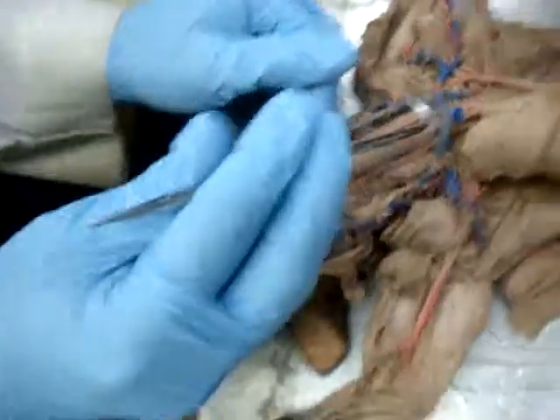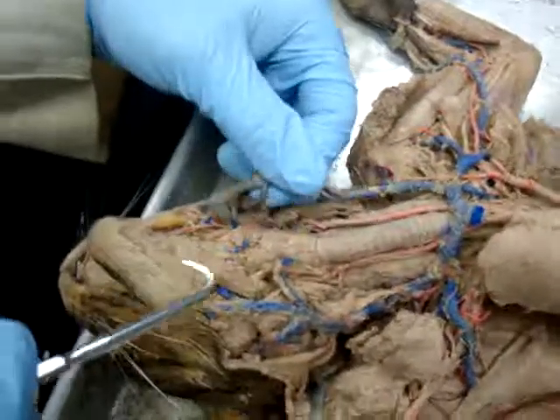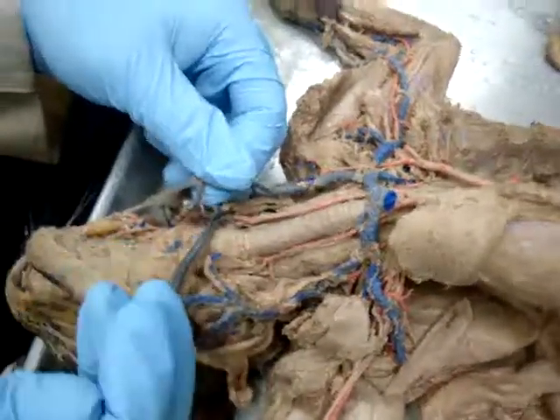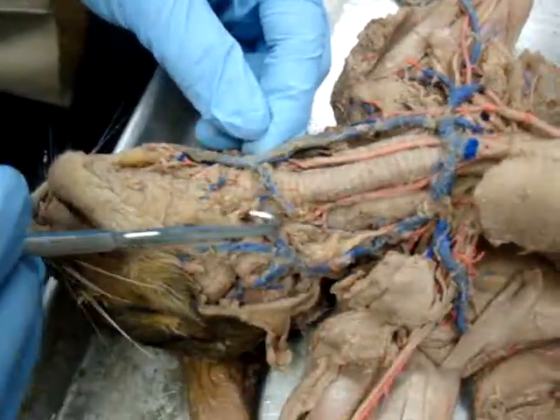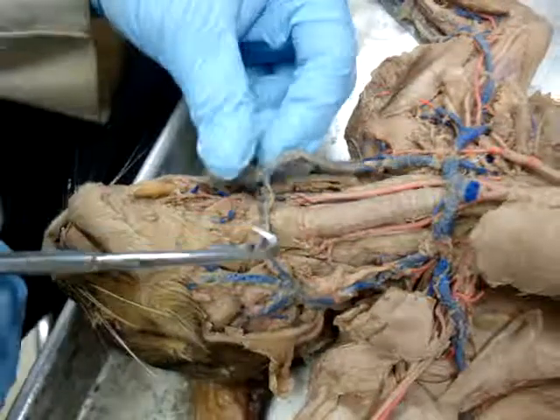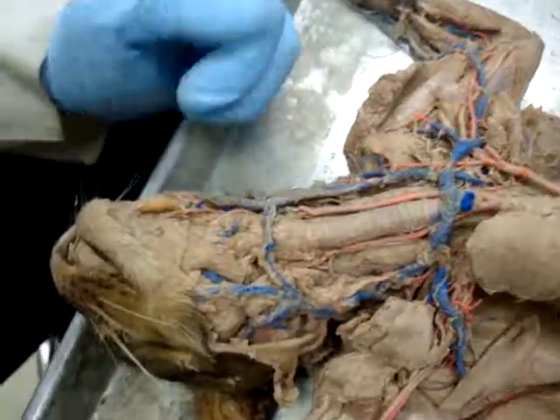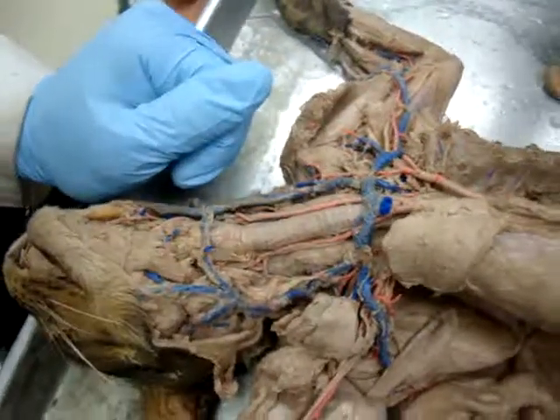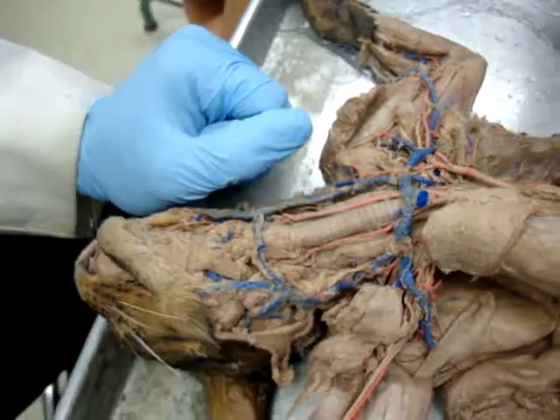So we've got the carotid artery bringing blood up, and we've got jugular veins bringing blood down from the head. This jugular in particular is a cat-only jugular. Transverse jugular. Now we actually say cat-only, but there are actually people that have it too. They're just variants. Some people do have transverse jugulars. Cats, however, do not have anterior jugulars.